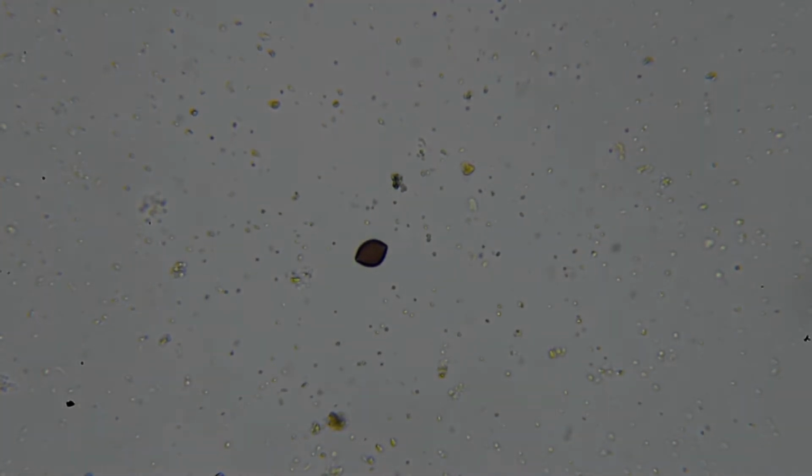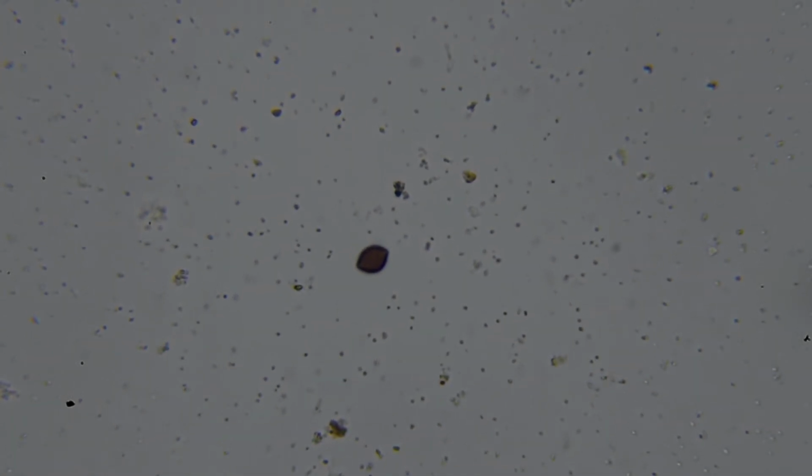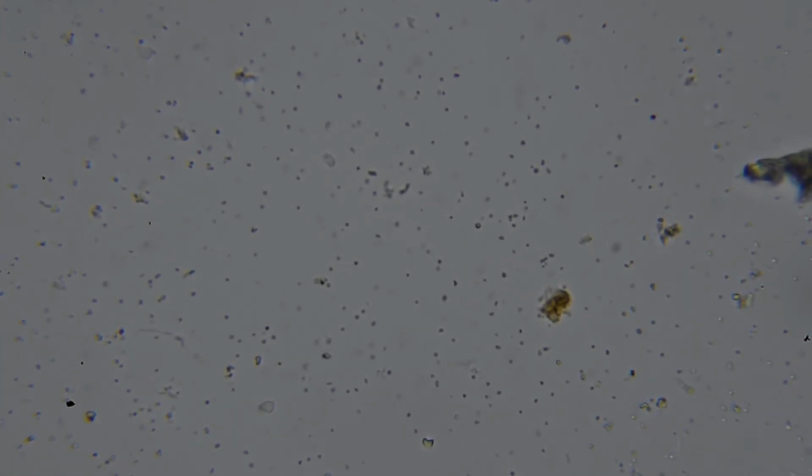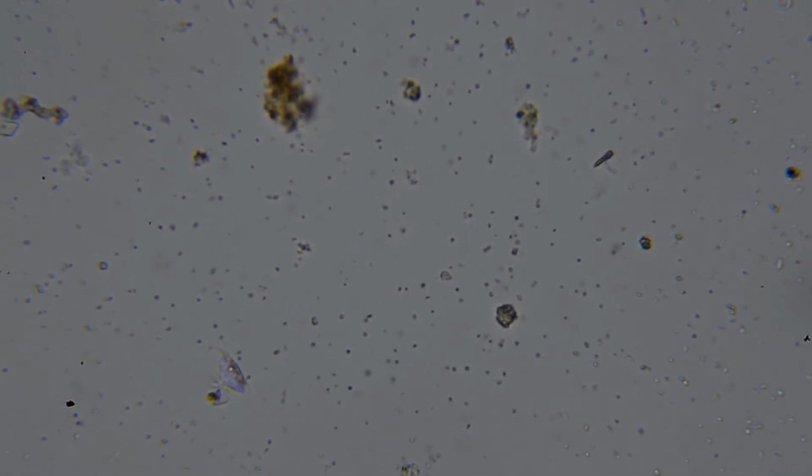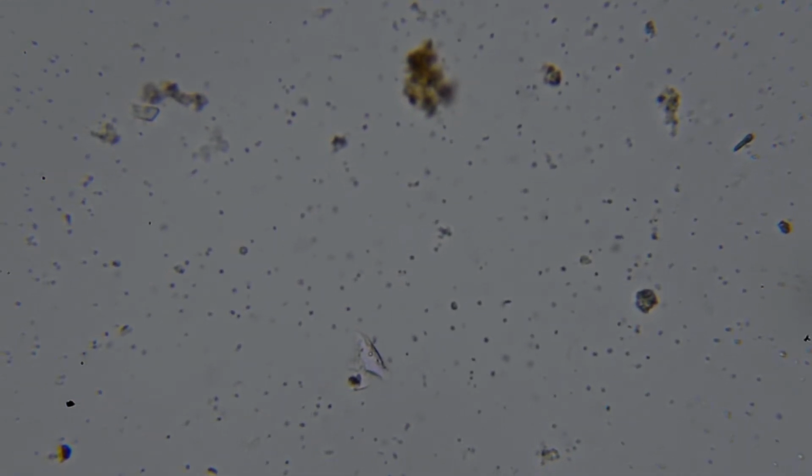But it's probably a beneficial one. The way that you tell a beneficial spore, or a VAM spore, an arbuscular forming mycorrhizal spore, from a normal one is that it has a little phosphorus deposit that you can see, which that one didn't. It appears as a little black dot if it's present. So lots and lots of bacteria you can see, very bacterially dominated.